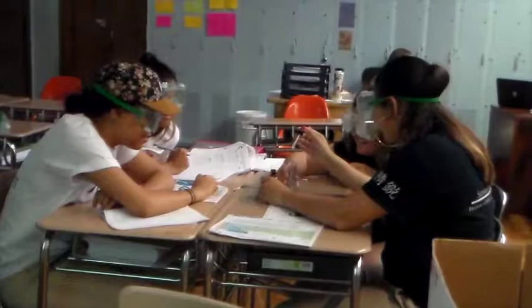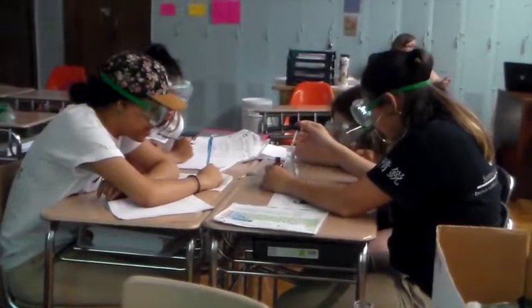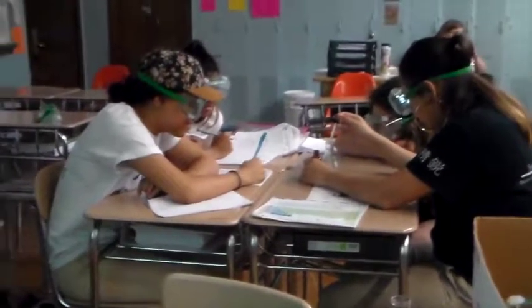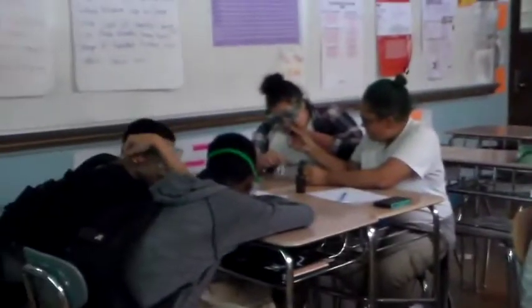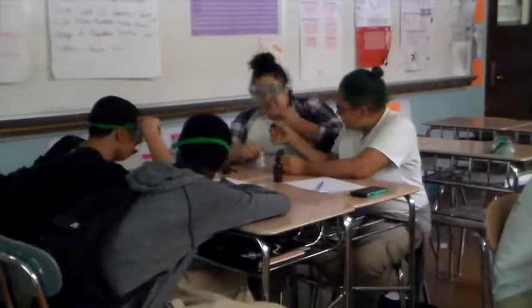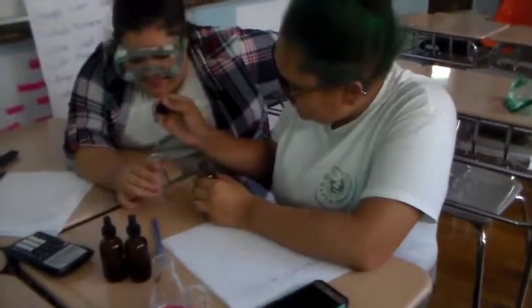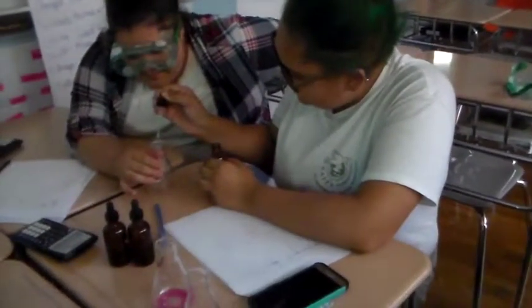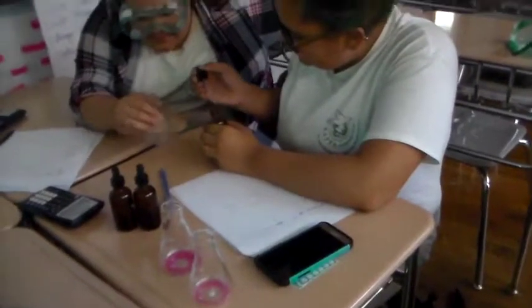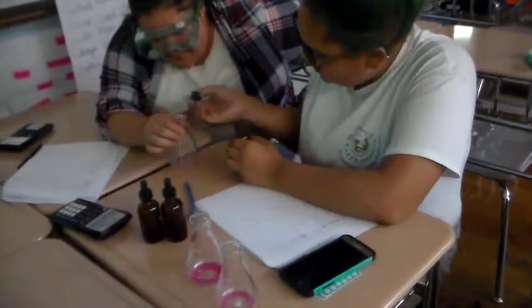It's okay. We're good. No, stop! It's 28? Okay, 28. It could be an error, I guess. It doesn't matter. Which one are we putting, 39 or 48? Didn't we get 41, guys?